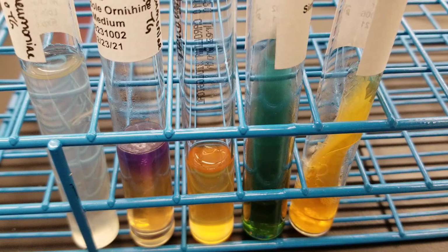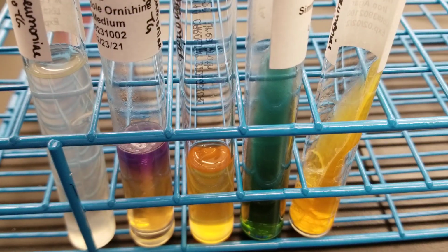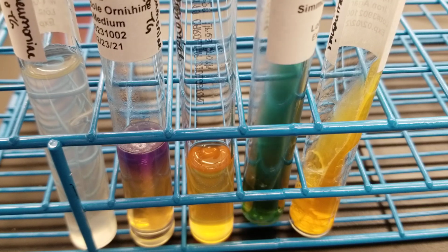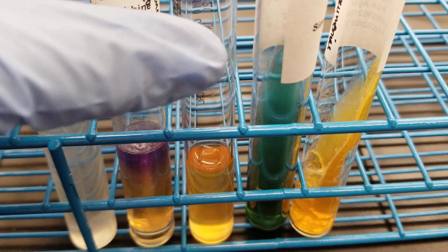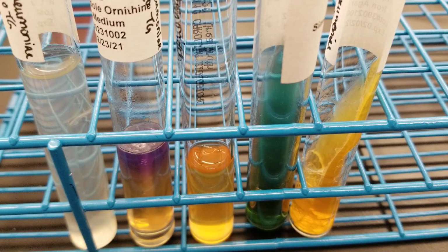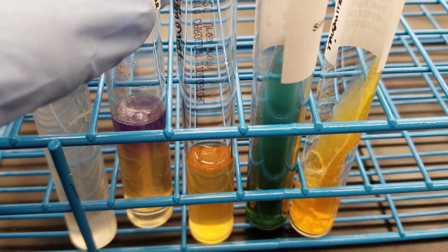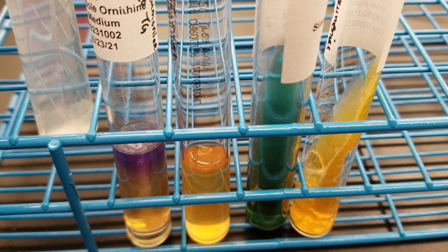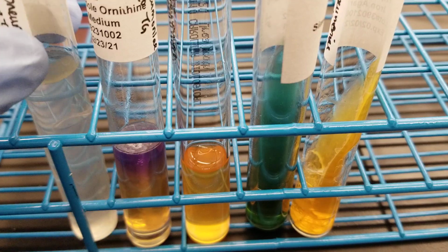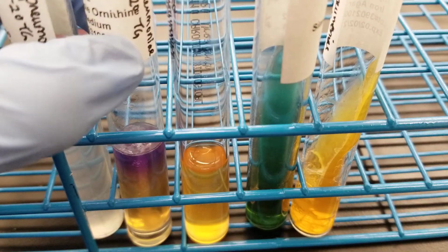We have the A over A with gas, so A over AG, that's expected. We have the citrate positive, so that bluing of the media there. We have a slight pink to this. It might look a little orangey pink, so be careful with that. And this is supposed to be negative, negative, negative. And we have no gas in the Durham tube, but we do have growth, so we're going to look for the color change there. So let's get started with the indole.